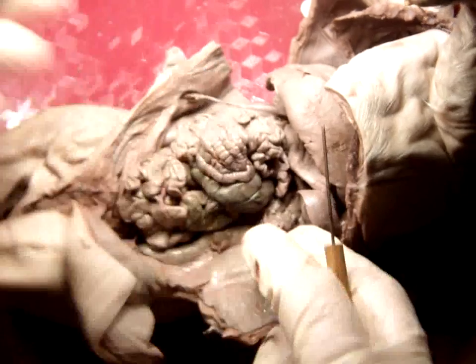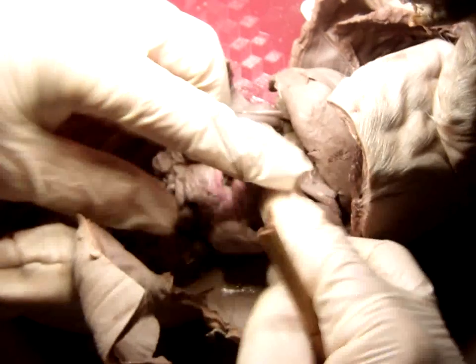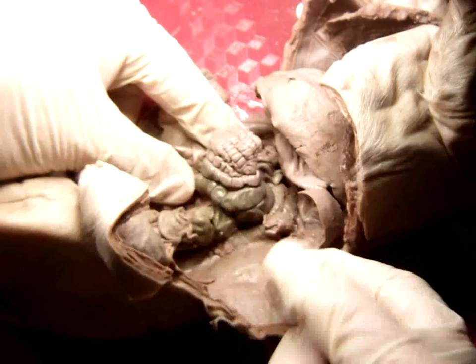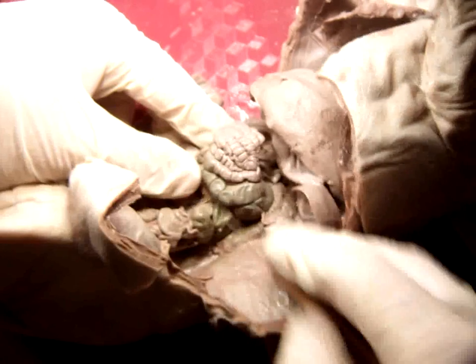Next on our list was small intestine. That's all of this kind of brain-looking structure here, small intestine. And then the large intestine is over here kind of by itself, all spooled and coiled together like that. Large intestine is the same thing as the colon, so this is also known as the colon.